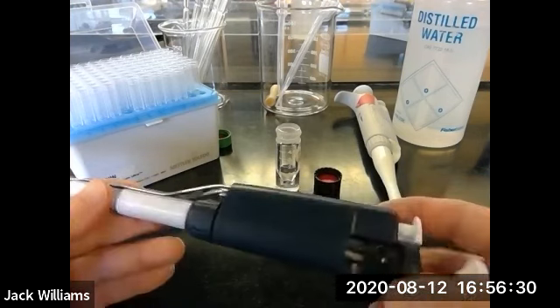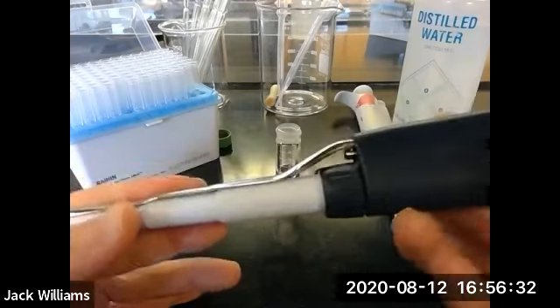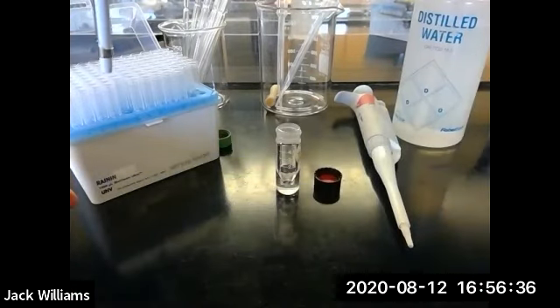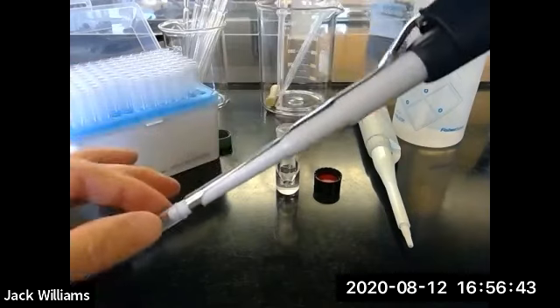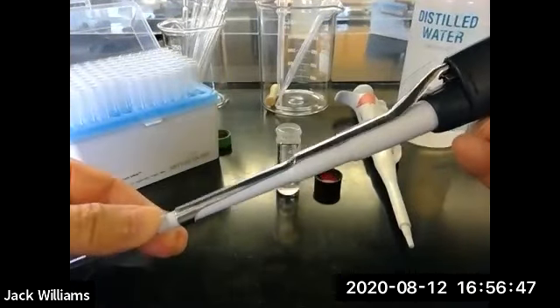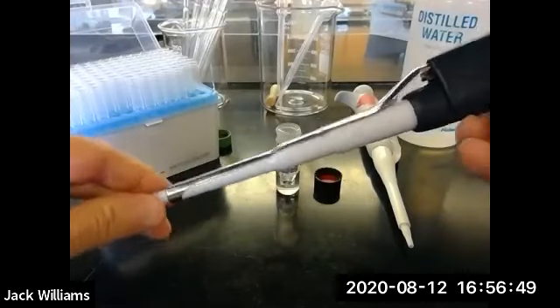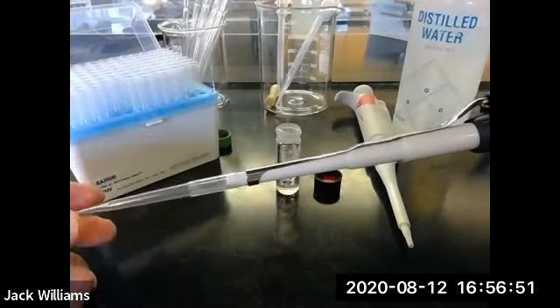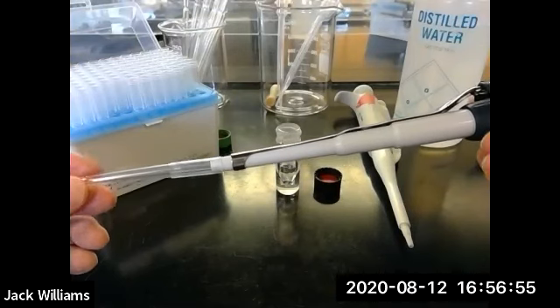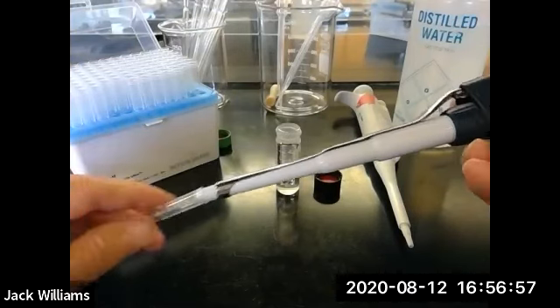So that's 600 microliters. We're going to use something called a pipette tip. If you get into some of the advanced labs, they'll have this set up so you can just insert it like so. What I would do in this lab is just take this and, with your fingers, make sure it's secure. If it's not secure and you can wiggle it, what's going to happen is you're going to end up with a pipette tip in the bottle of methylene dichloride, and you don't want this.